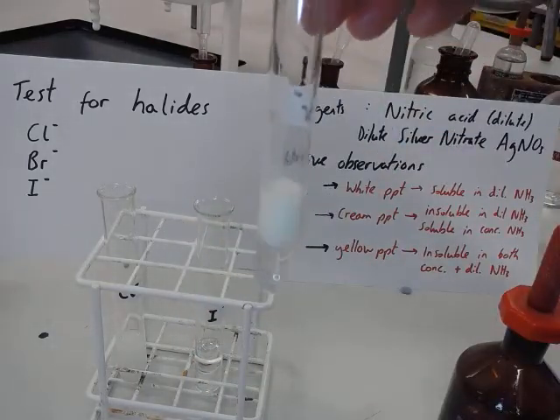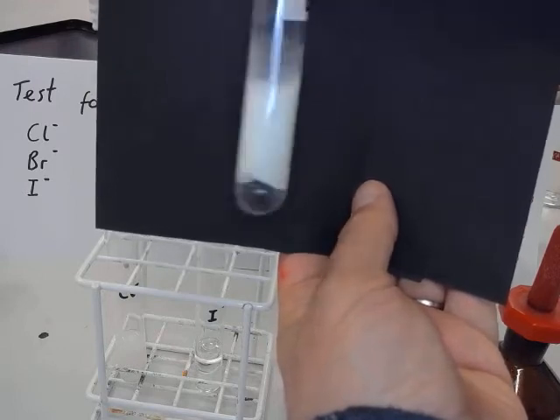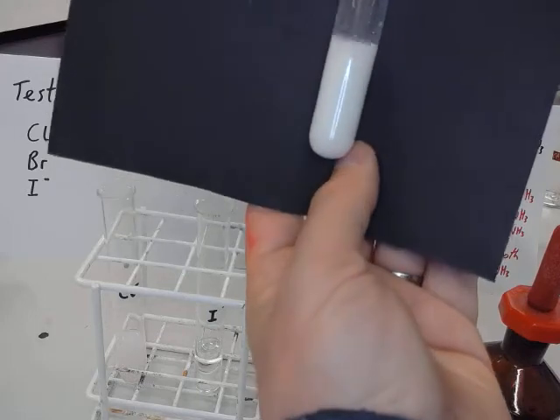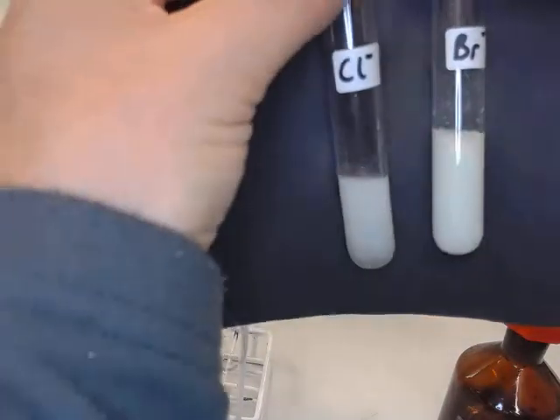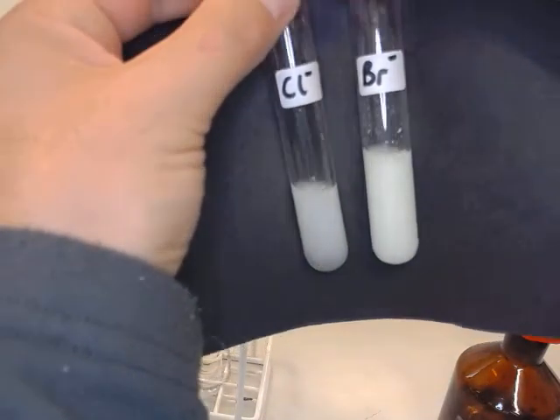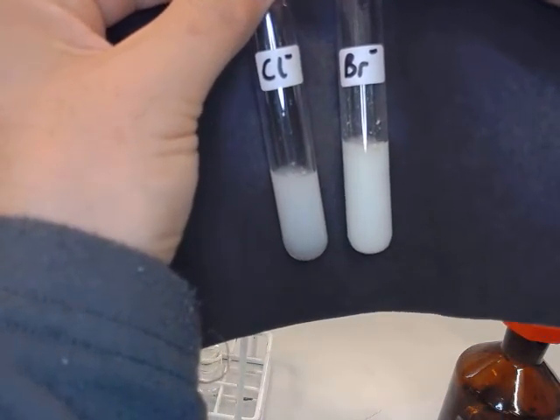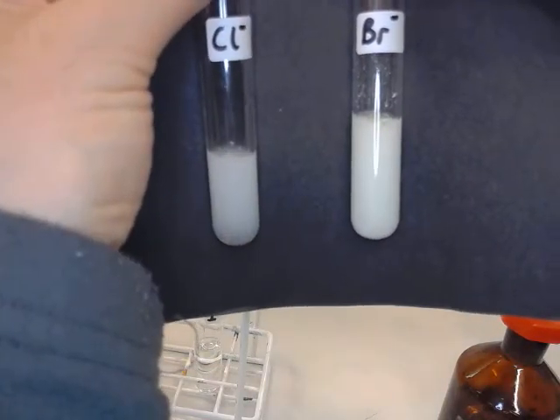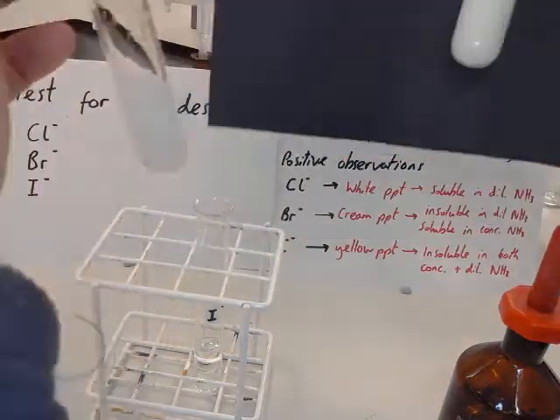Okay, so let's precipitate there again. Now, see, it's quite hard to say, you know, is that white or cream? You compare the two. So see, the bromides are kind of, it's like a different shade. Not the easiest thing to see. You can only tell by comparing them, really. If you take it by itself, which that's white or cream. Oh, cool. Next to it, you can see this one is more of a white, and this one's a slightly off-white.